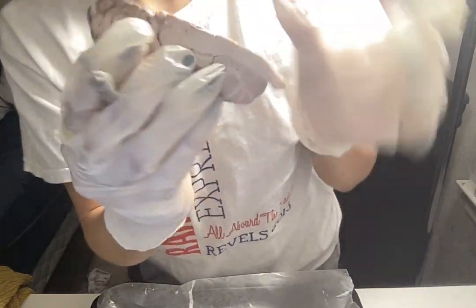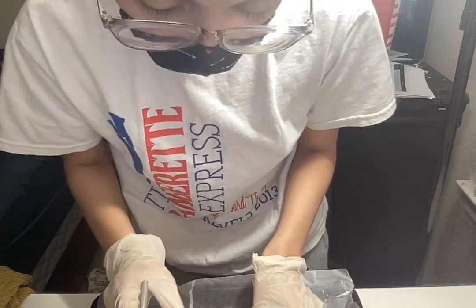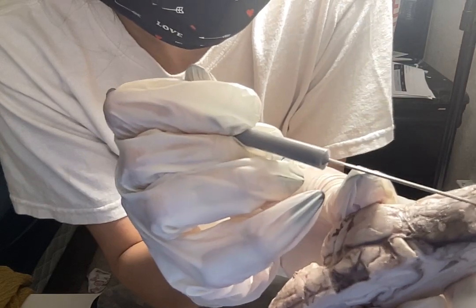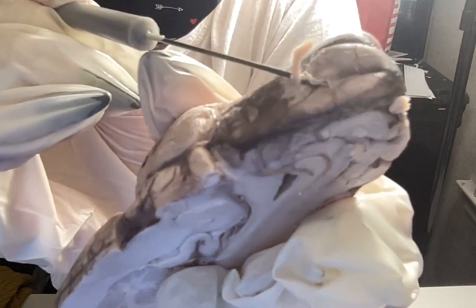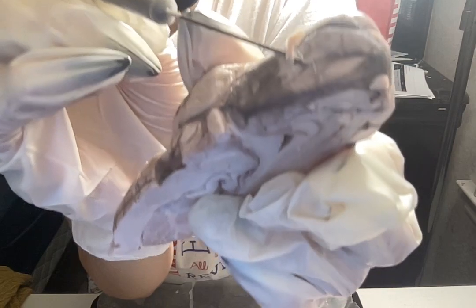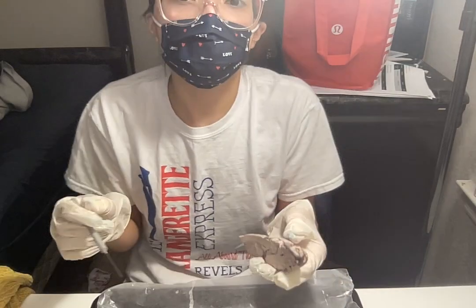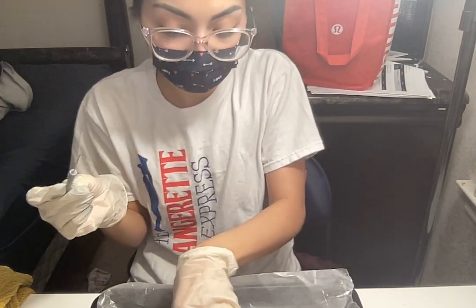Going towards the front here, actually I think you can see it on the other one better. Yeah. So this little thing kind of sticking out here. Oh, here we go. So that little thing right there to the front of the brain by the frontal lobe is the olfactory bulb. So the olfactory bulb is used to help us relay and process our sense of smell. Okay?